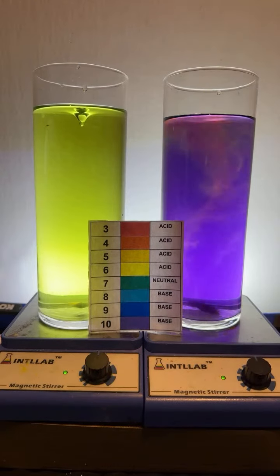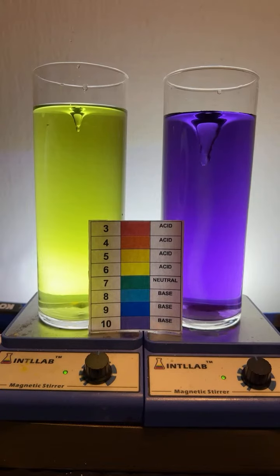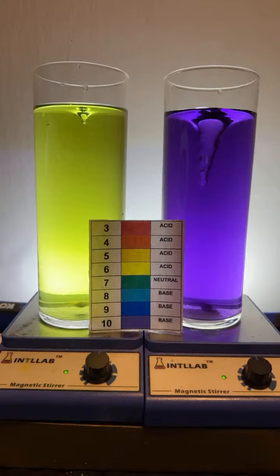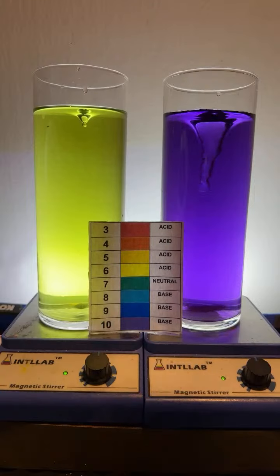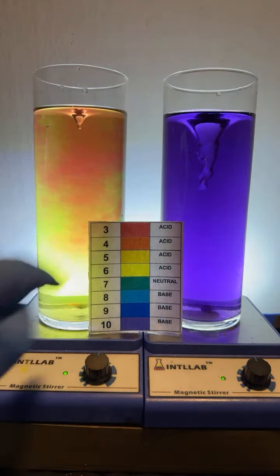What's this question? Are you able to swap the colors by increasing the opposite? Meaning, can you add enough base to the acid to make the whole thing a base? Yeah, so here we go. Over here on the left, we're going to make this very acidic. I'm going to add a bunch of acid, and the pH is going to drop. We're going to get pH 3.